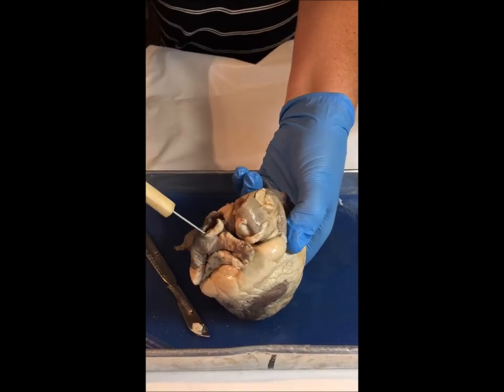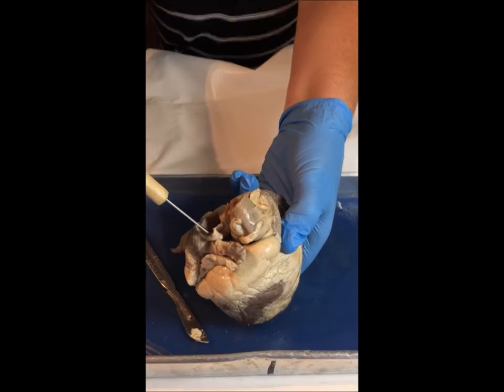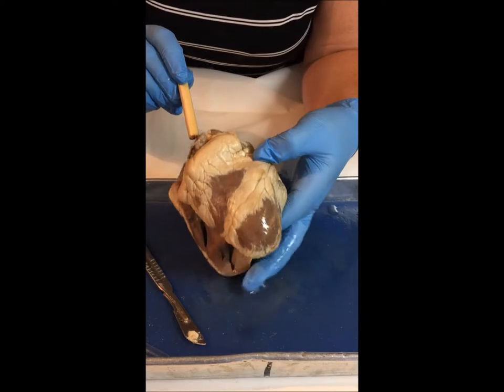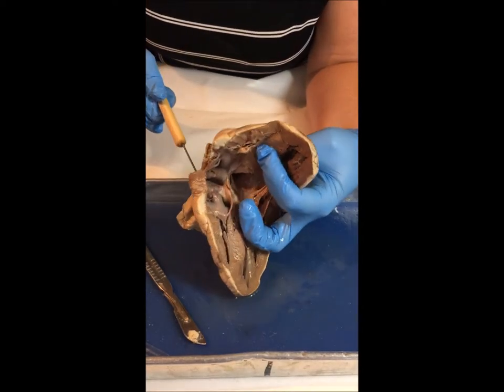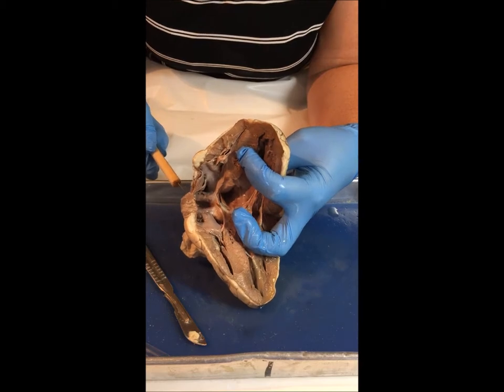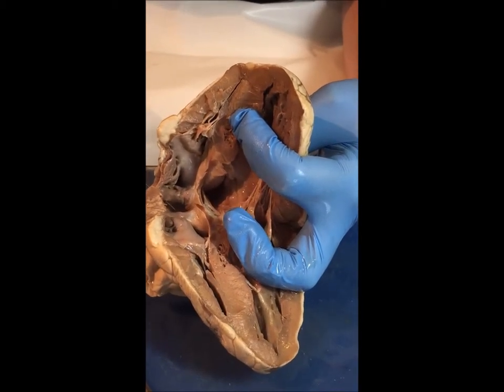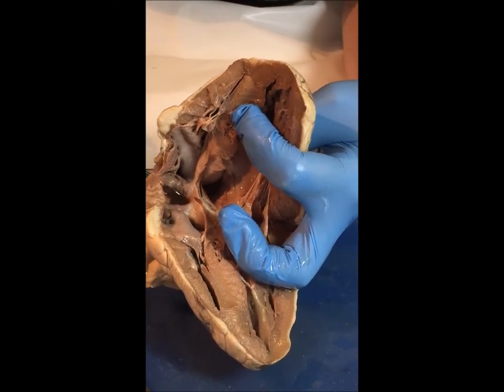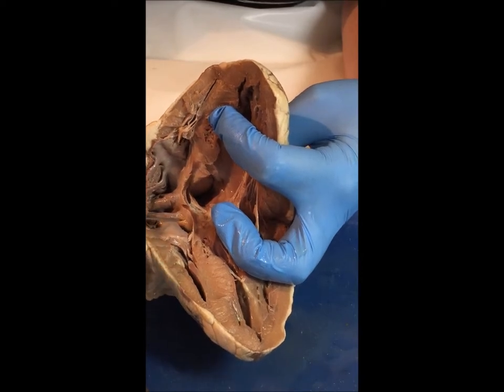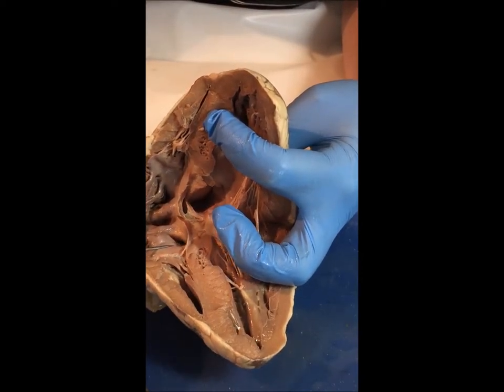If I'm looking here more on the backside or the posterior of the heart, I'm looking at the inferior vena cava. If I were to insert my needle tool through here, it would go right up into the right atrium. You can see how small the right atrium is — a lot of times when we look at the diagrams the right atrium looks large, but it's not. If I trace the blood, it would go through here — this would be the tricuspid valve.